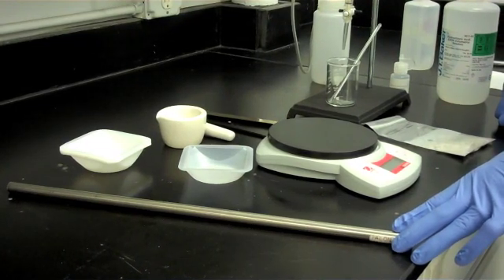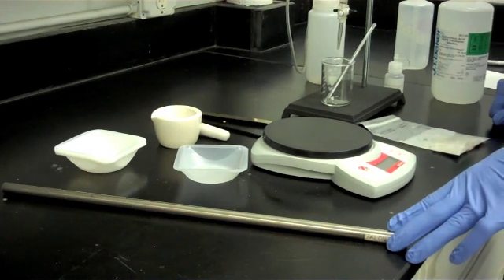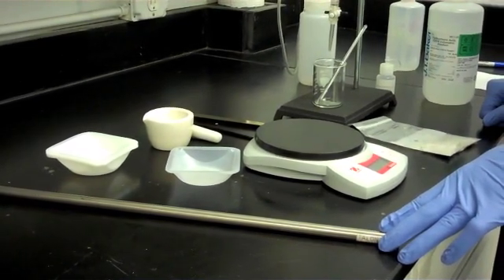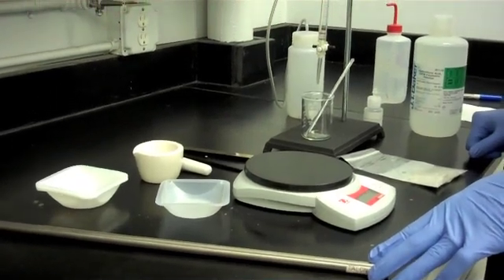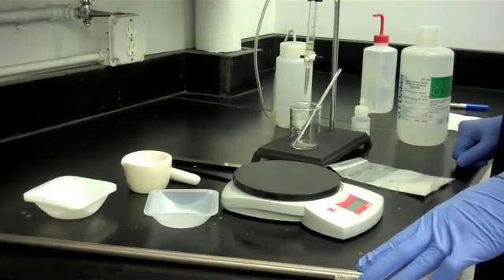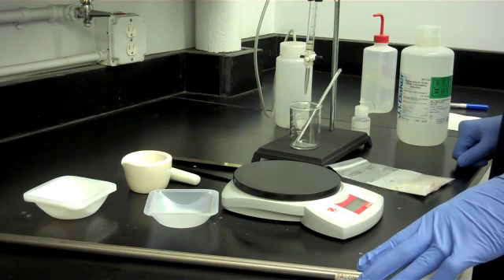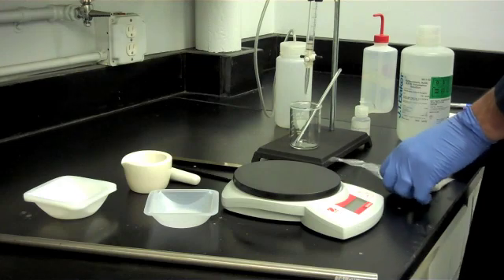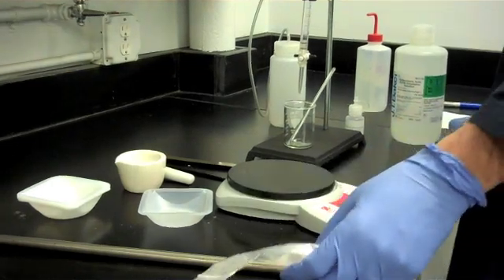As the salt cools, it will begin to flake off the rod. If the salt doesn't fall off the rod in a few minutes, lightly tap it on a hard surface and the salt will fall off. After the salt has cooled enough to handle, transfer it immediately to a Ziploc bag for storage purposes.